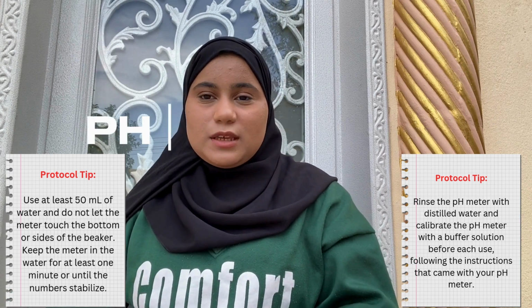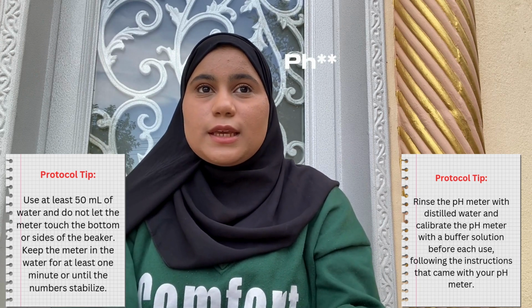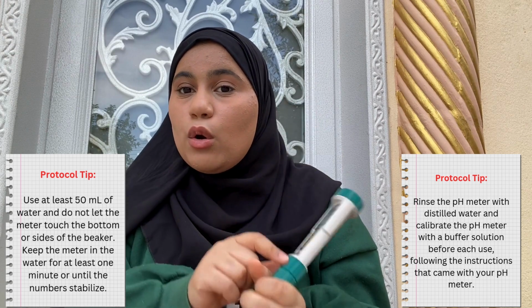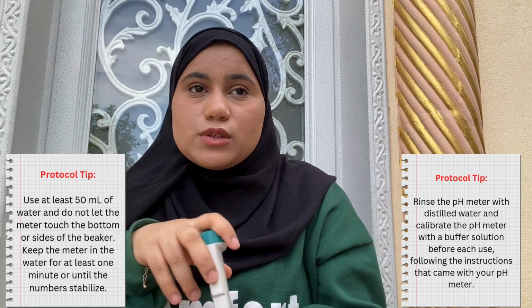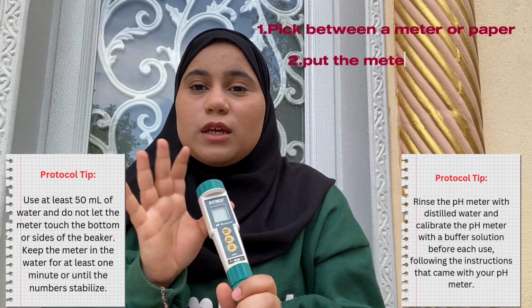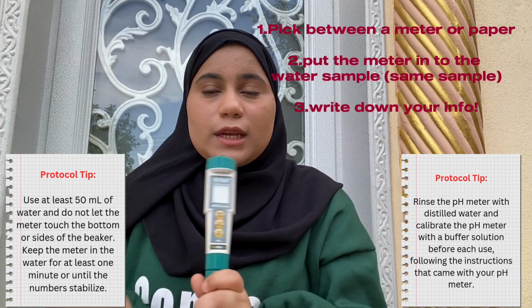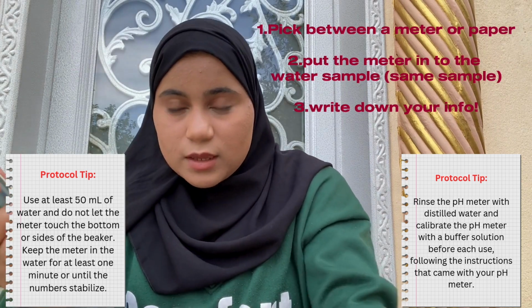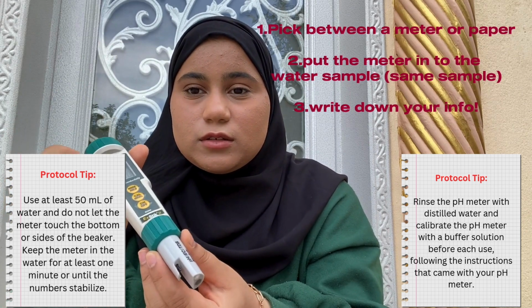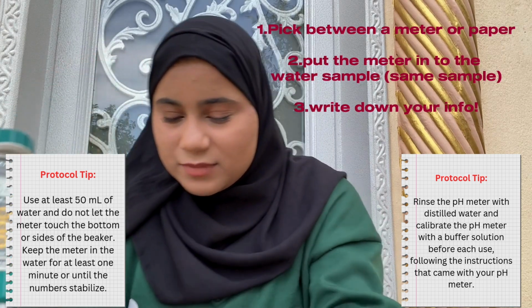The second thing we are going to get the information about is the pH. I think it's pretty easy. For the pH, we can use the meter, which is this right here, or we can use the strips, which are I think common, so you can use those as well. They're all going to give you the same number. So here is our little thing.